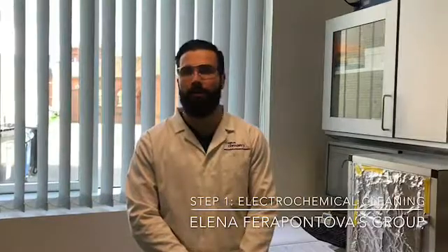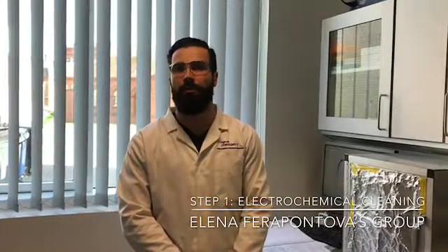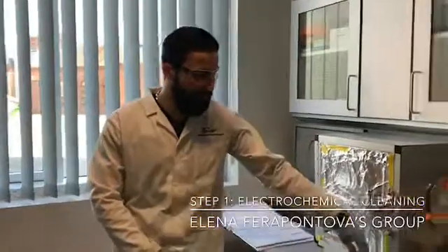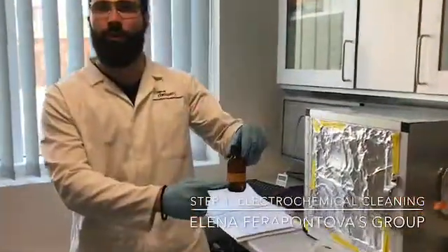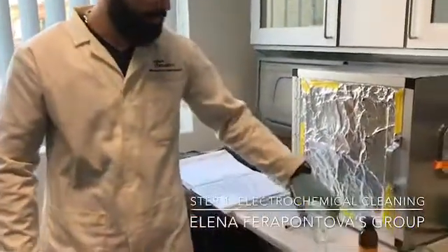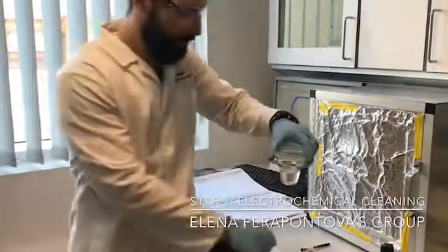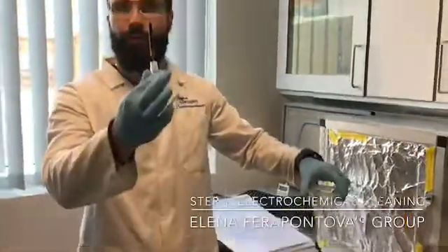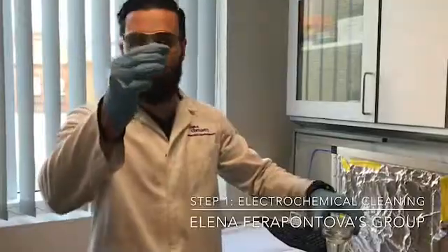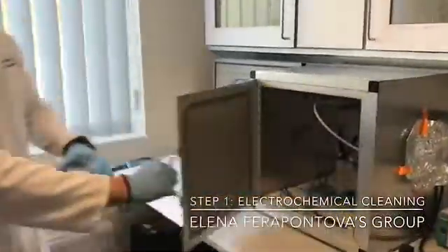In order to obtain a good clean electrode, first you need to do the electrochemical cleaning. For this you need 0.5 molar sodium hydroxide, which I will prepare. You need this glass cell and you put some of this sodium hydroxide in it. Next, you take this gold electrode, you fit it with the holder, and open the Faraday cage.